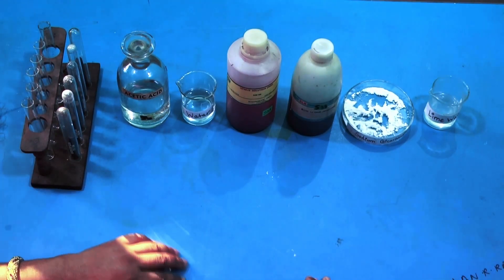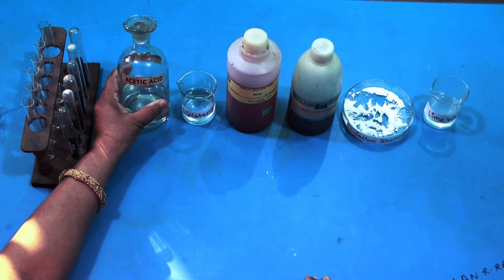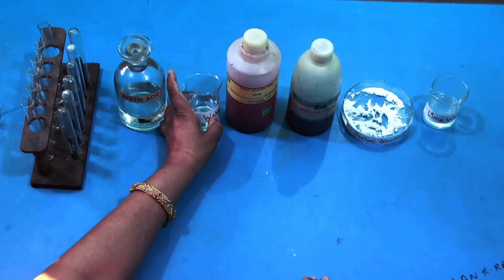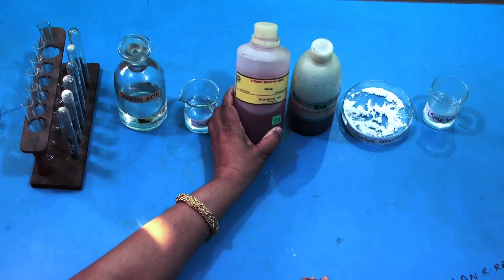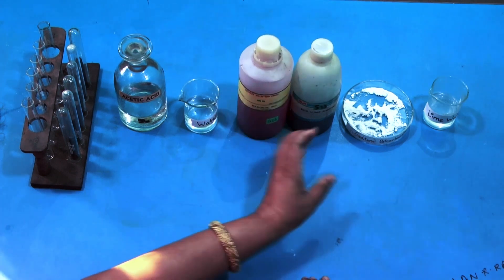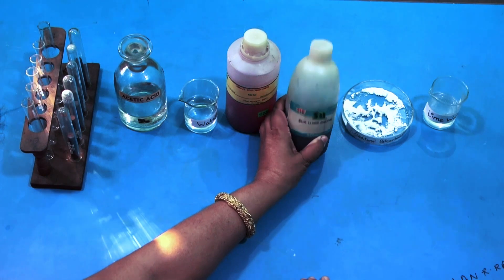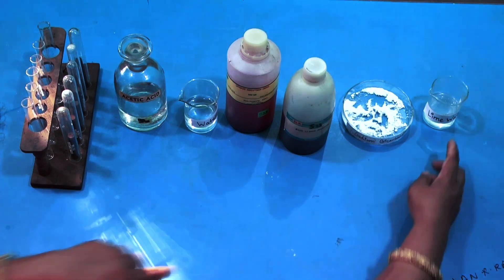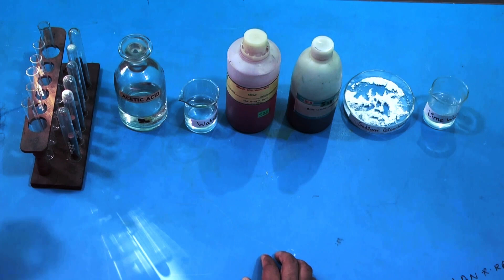We will be requiring acetic acid, then water as per your book, then red litmus solution — this is red litmus solution, children — and blue litmus solution, sodium bicarbonate, and lime water. Now we will be performing one test at a time and writing the observations.